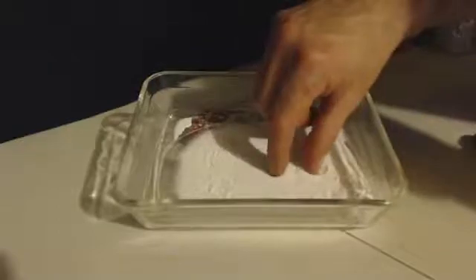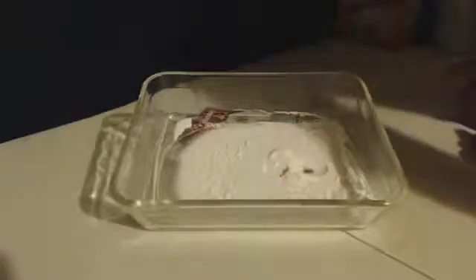I want you to see it's still the same texture, it's like flour. You can't even tell the difference between the baking soda and the sodium carbonate we just made - they both look identically.